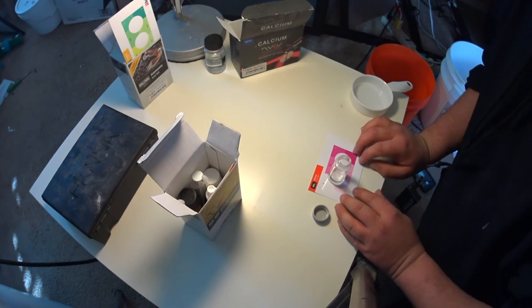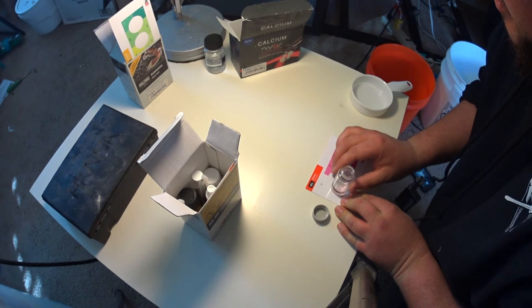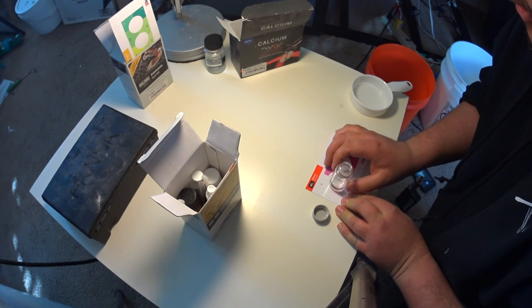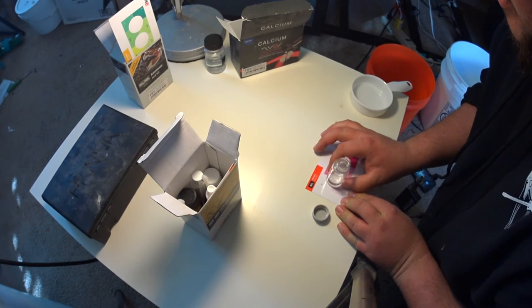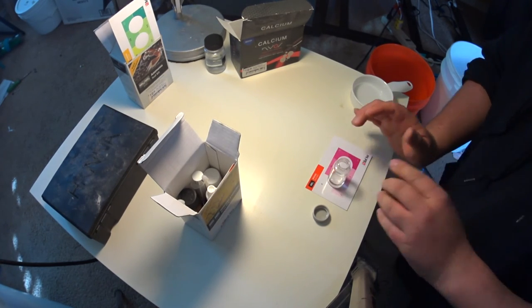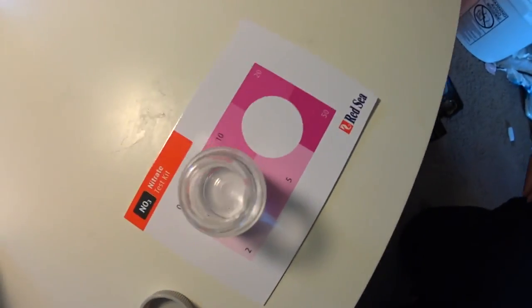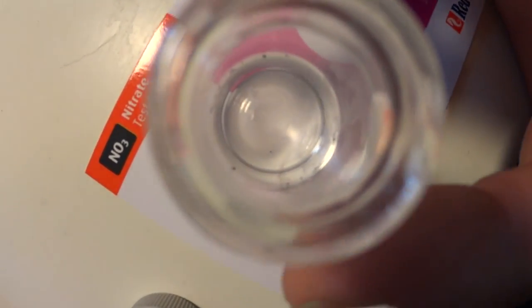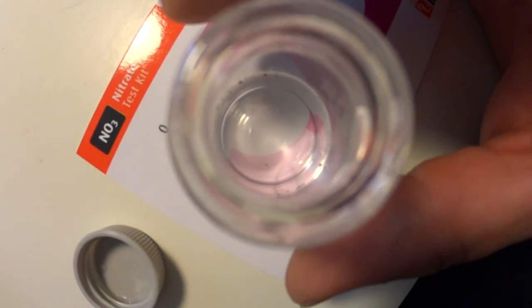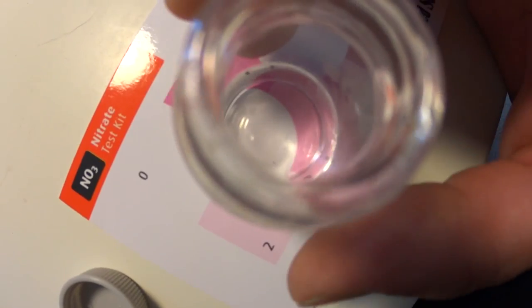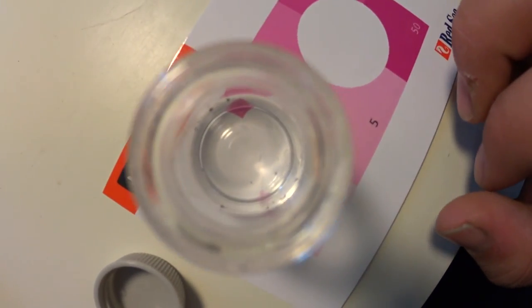All right guys, it's been about 10 minutes. So let's see. Okay, definitely not two parts. It looks like, yep, looks like we're at zero. So let me do my best to show you guys. So here down in the test tube, we're going to move it over to 2 and you can clearly see the pink there. And obviously it's not going to be any of these higher ones. I'm going to go to zero and it just looks like clear water.